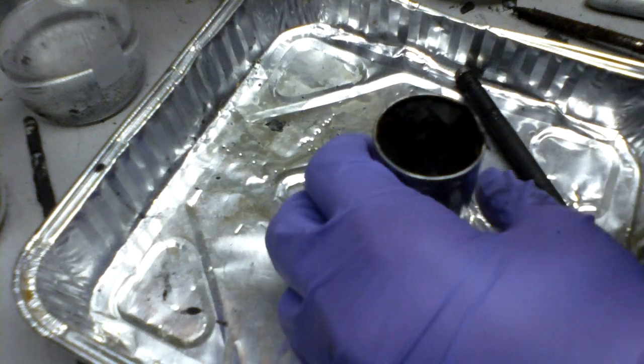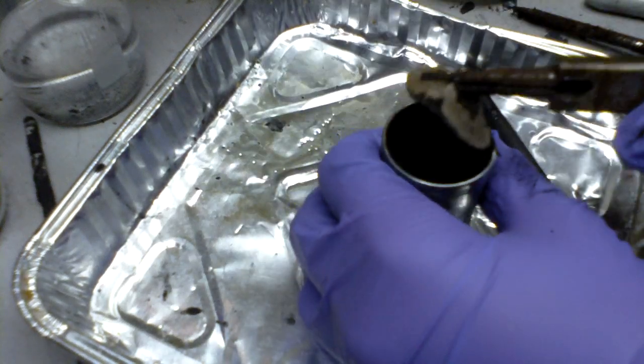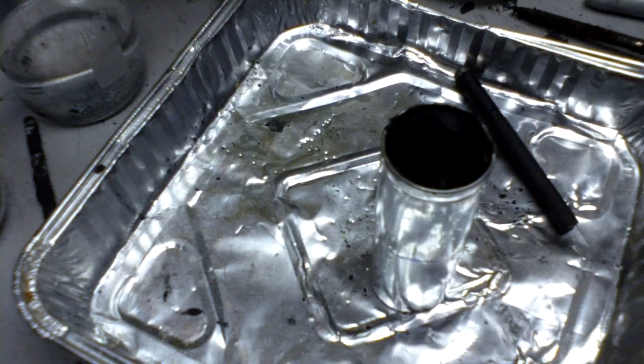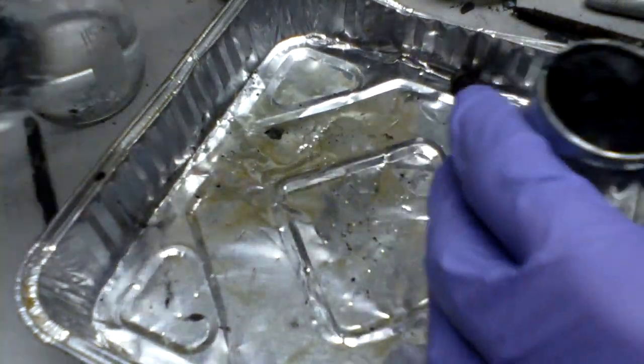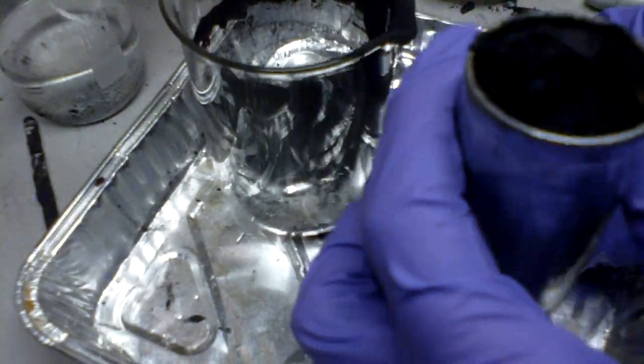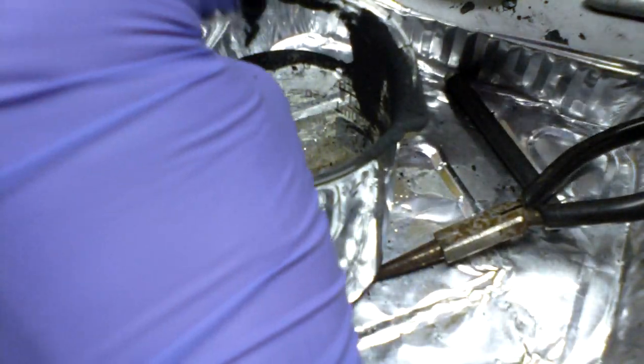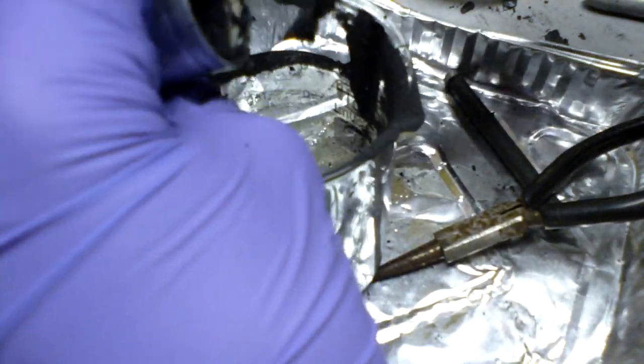Inside you'll find a whole bunch of brown paper throughout the battery, mostly lining the walls. Now that you opened the battery, you have to speed up your work. I'll just start using a screwdriver and start scraping out all of the chemicals inside the battery.